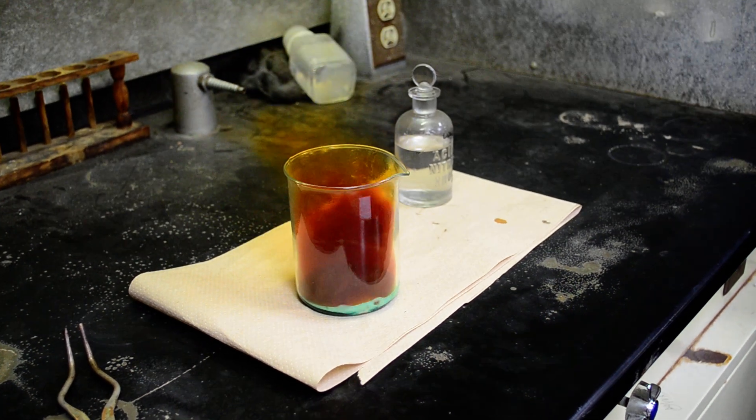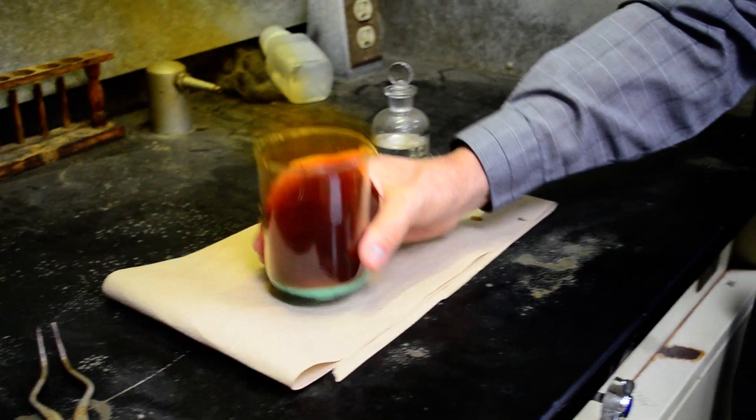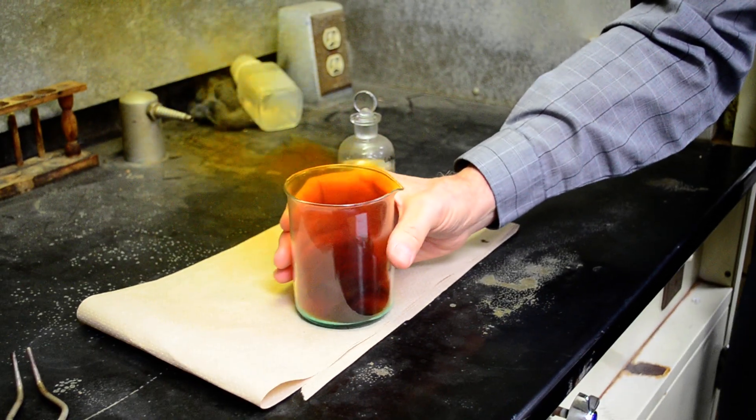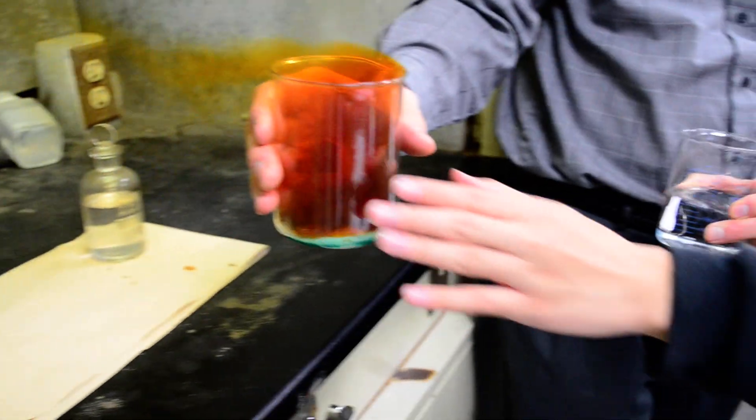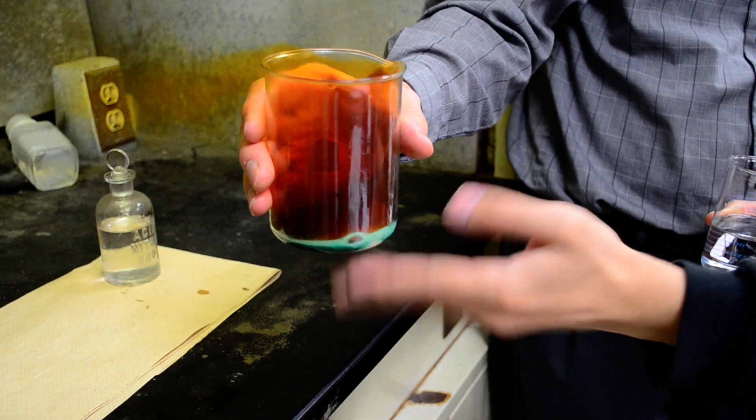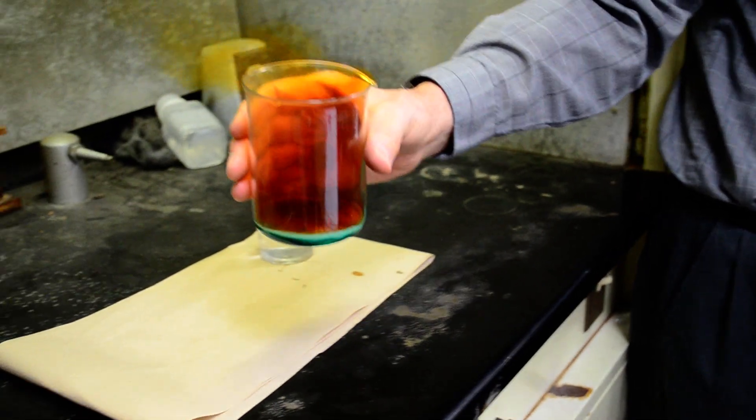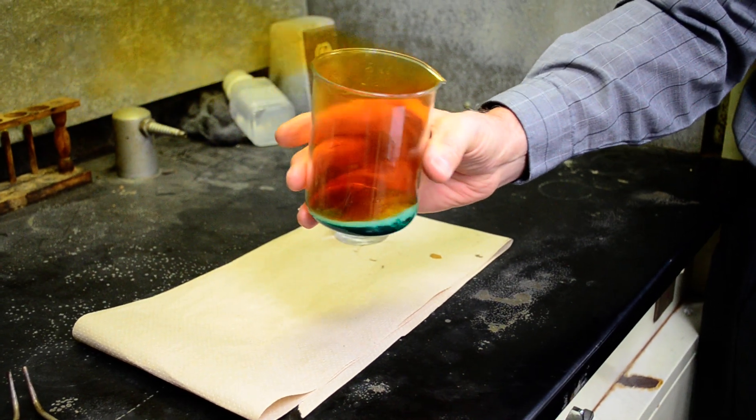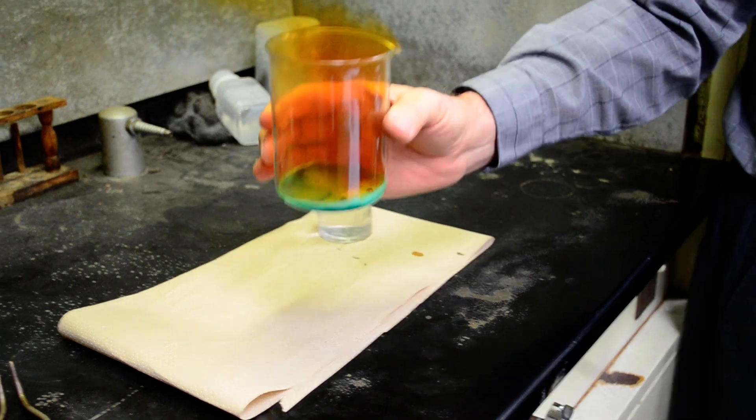The exhaust fan is on because this stuff is not... Oh, that's warm. Put your finger under there. On the bottom. Oh yeah, it's hot, isn't it? You got an exothermic reaction here. Yeah, exothermic.